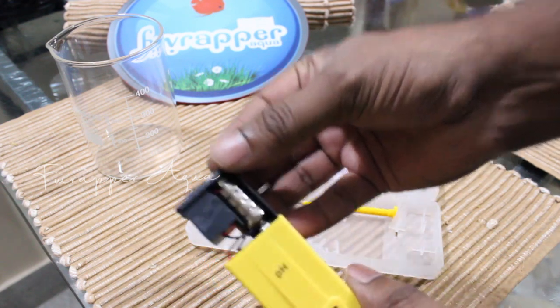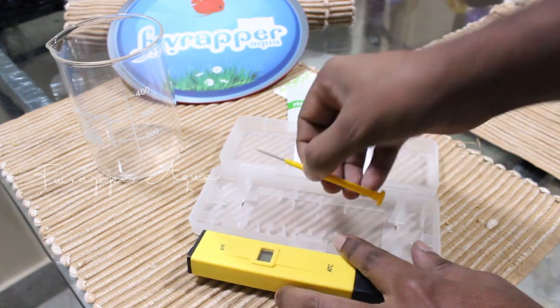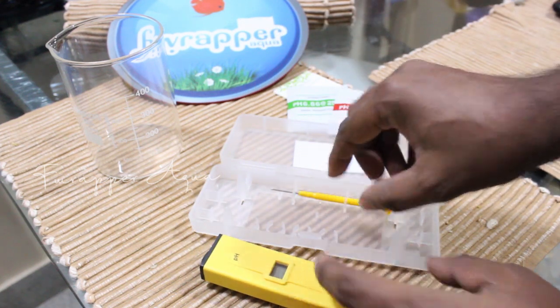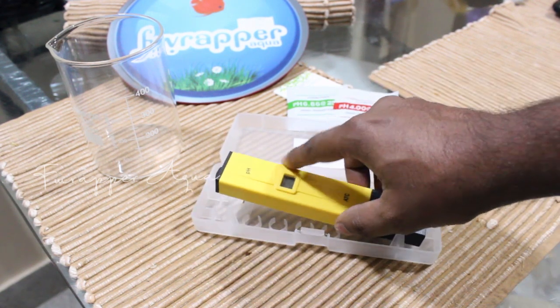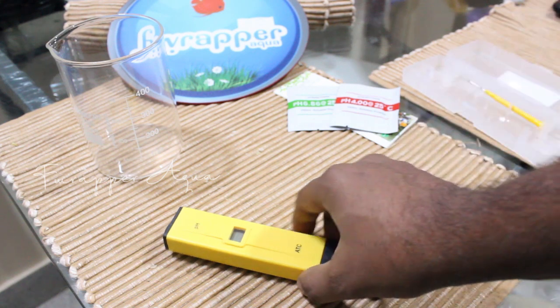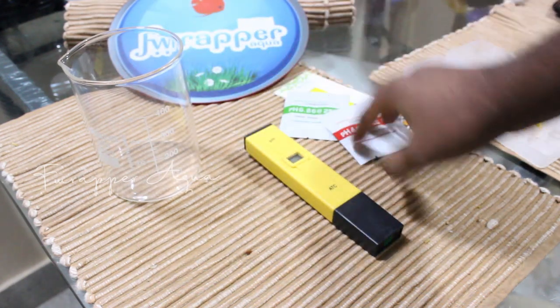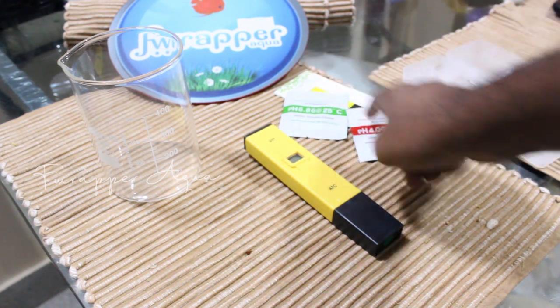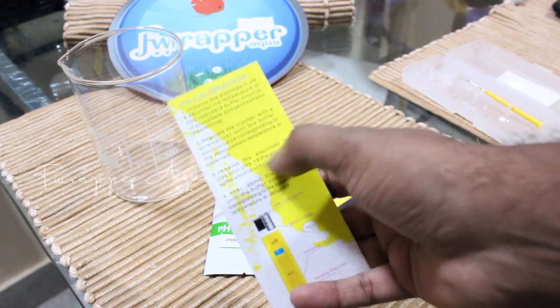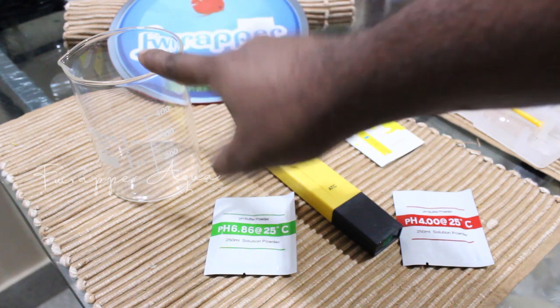This is where the electrode is, where the reading comes in, and this is the on/off switch. This is where the calibration screw is inside. It's already got batteries — four small batteries included. They've also given a small screwdriver for calibration; you turn it to get the right reading. You'll also need distilled water, which you can get at shops that recharge batteries.